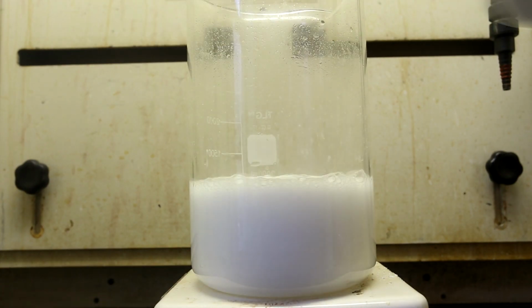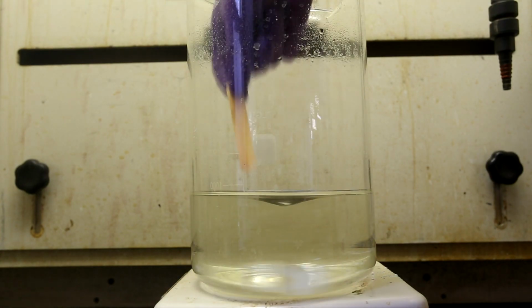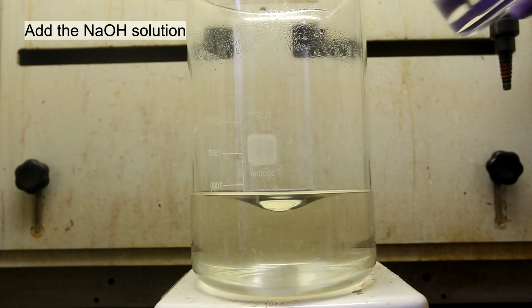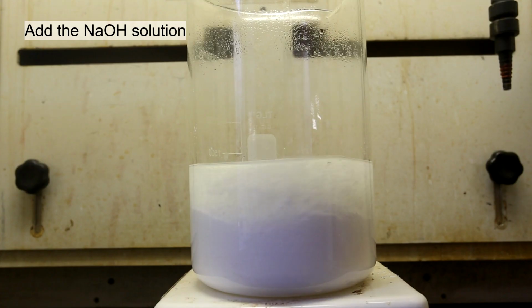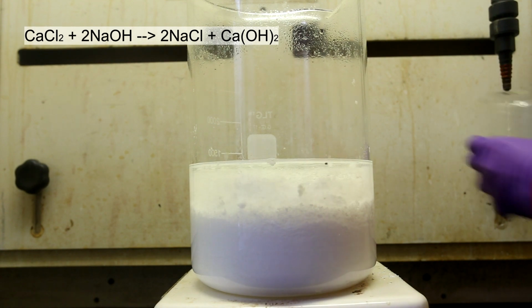Once you have added all of the calcium carbonate, keep stirring until the solution completely clears. The final pH of the solution should be acidic because there was an excess of hydrochloric acid used. Add the sodium hydroxide solution that we made earlier, and you'll see the calcium hydroxide immediately precipitate from solution. The reaction occurring is shown above, where the calcium hydroxide is almost completely insoluble in water.